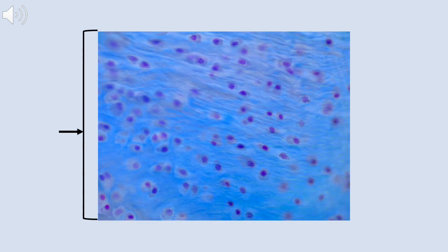All right, our last slide for this practice quiz or demonstration or study tool, however you want to think about it, is a blue staining tissue. That indicates that it probably was a Masson stain that was used on this, which means it's probably connective tissue. And if I look closely at the cells, I can see that there's actually a little kind of ghost-like hole that they're within. So that's most likely a lacuna.